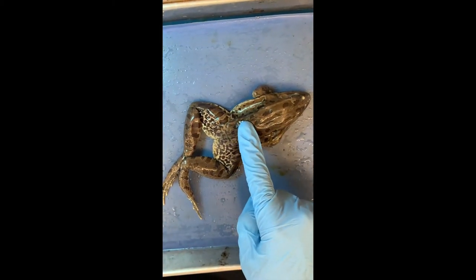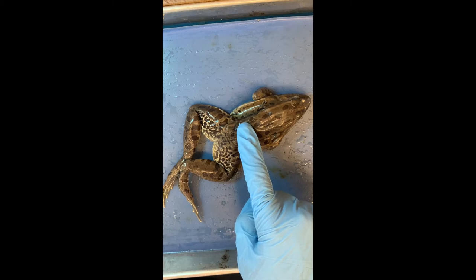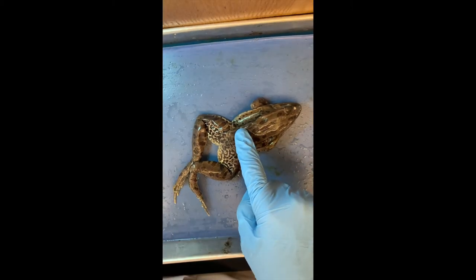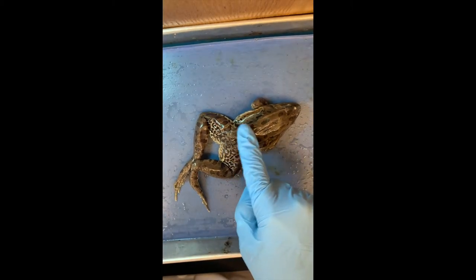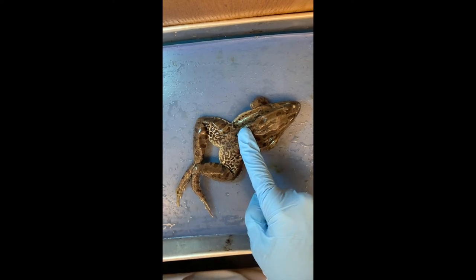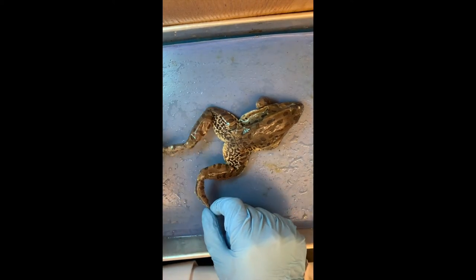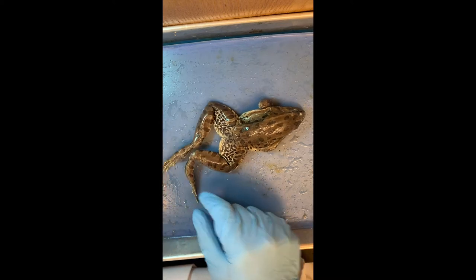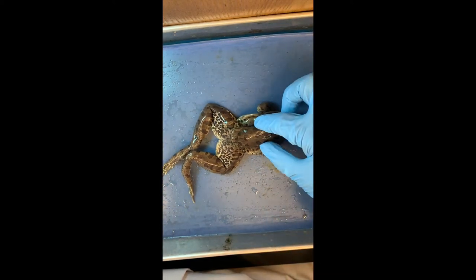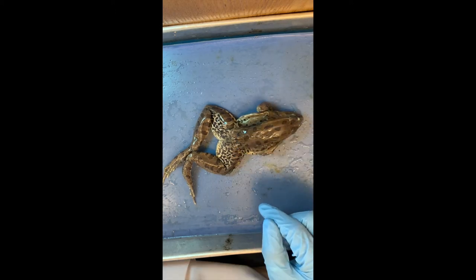So that makes them part of what phylum? Vertebrata, which is placed in the chordates. You wouldn't think it would have a backbone — it looks really squishy. But I can feel it has bones. It's not that squishy.